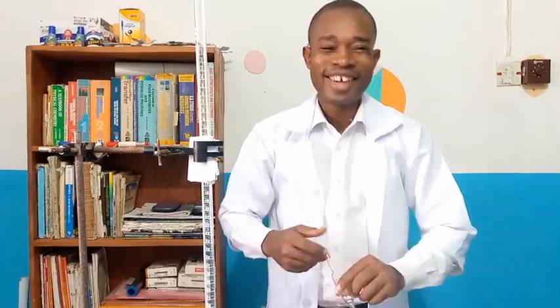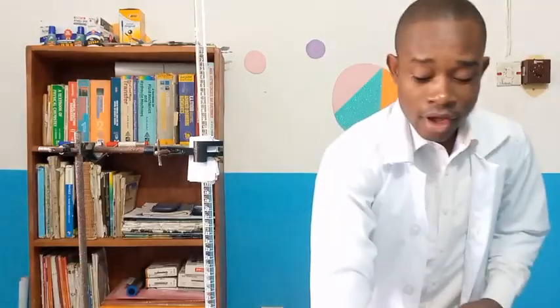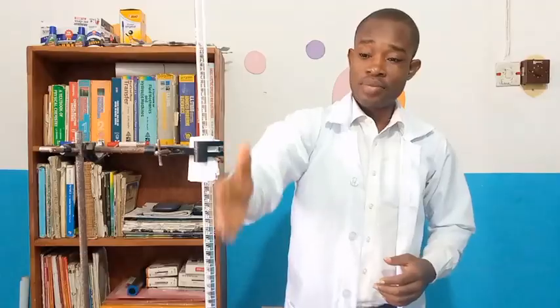So of course we need our acid and our base for this reaction, which, like I said, the acid is going to be in the burette, and the base is going to be in our conical flask. That is the one we are going to pipette, 25 centimeter cube portion of the base. So essentially, this is much of the apparatus and the solutions that we need for titration experiments.